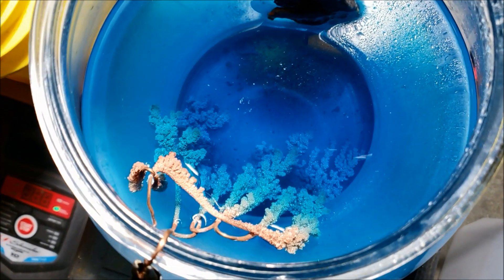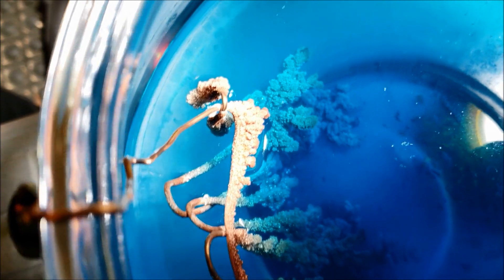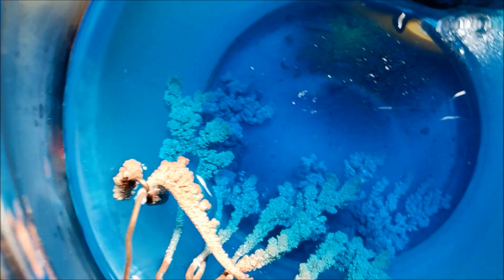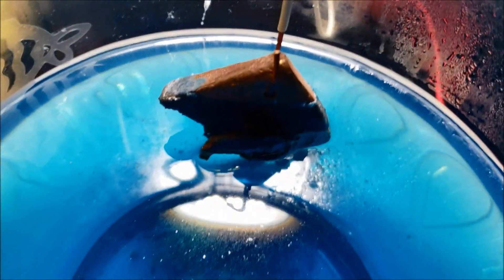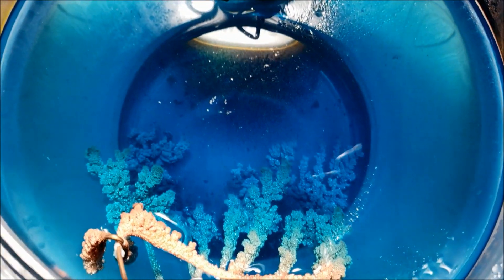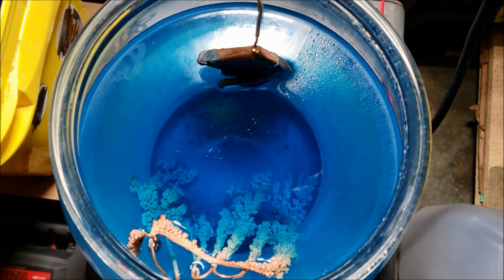Check it out - it's been running for three days. I don't know if you can see those crystals forming there - pretty cool! My anode's starting to deteriorate. Awesome. I'm going to let it go for a while longer and see what happens.